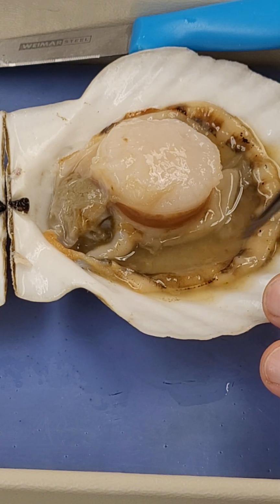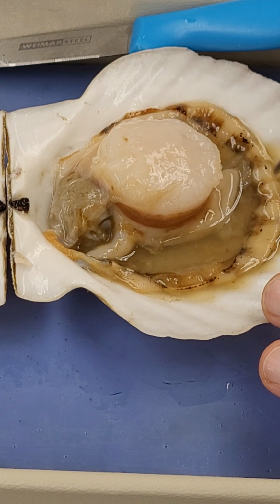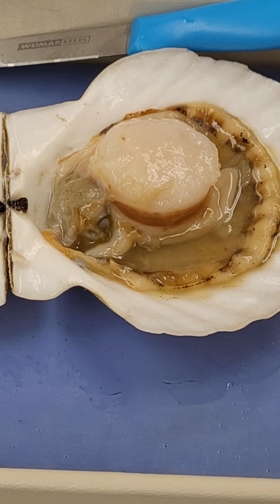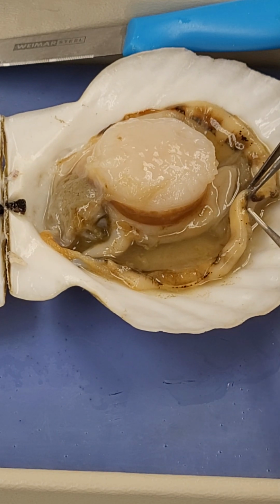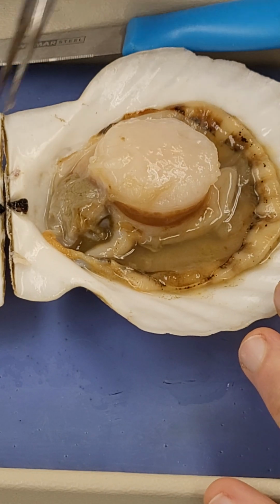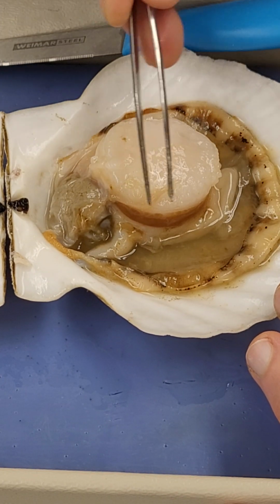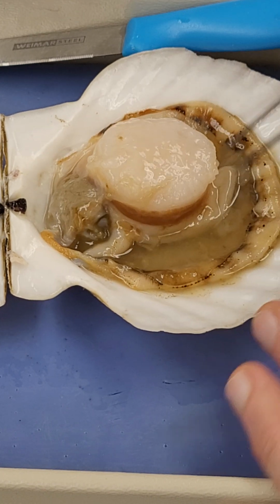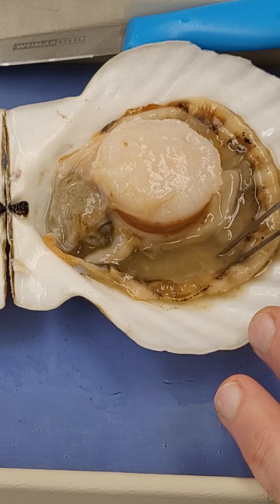Okay, well, this here is our mantle around here, and on this are tiny little black dots, which are actually eyes. You can see these alternating all the way along, so eyes all the way around the mantle. Together with the other mantle folding over the top, it forms a mantle cavity. So water coming into the organism is then going to pass across these ctenidia.